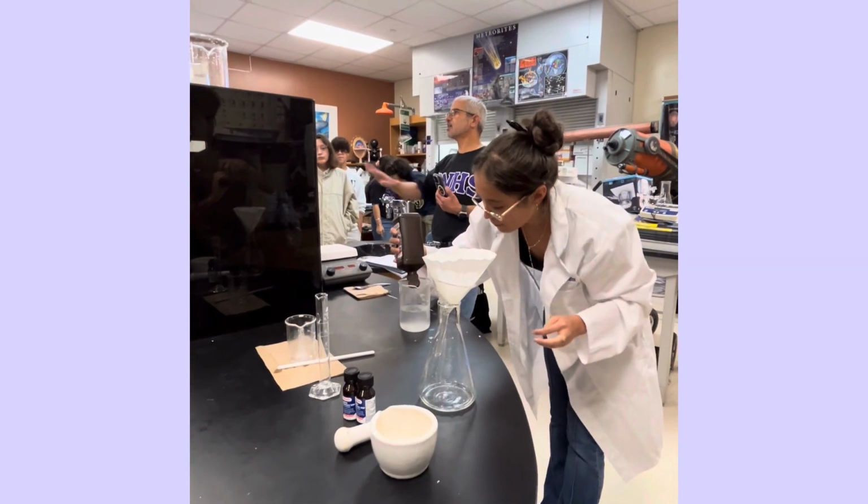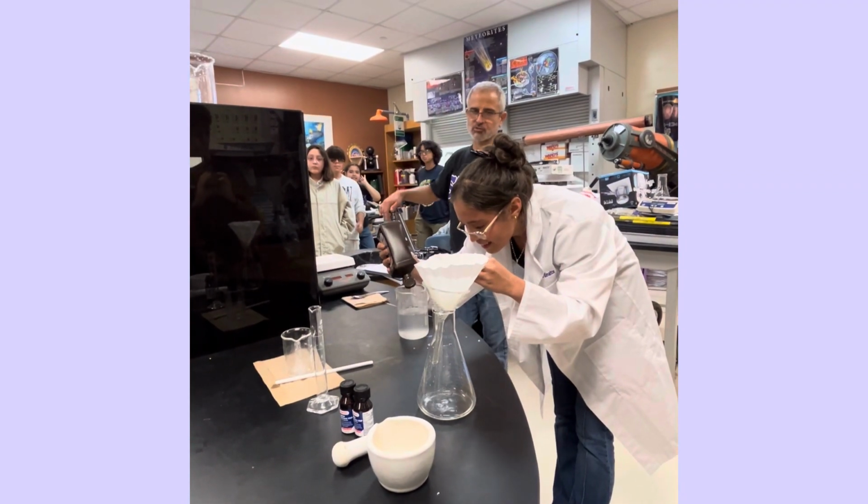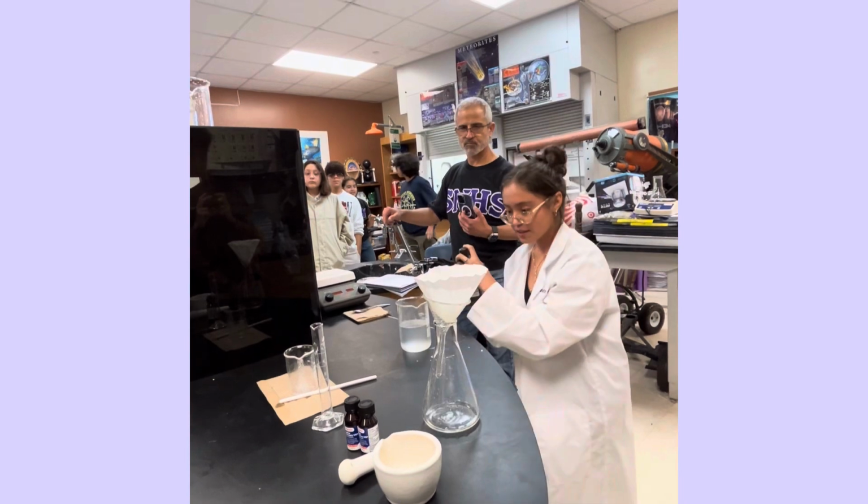You're not missing anything. Sí, no se preocupe. It'll all happen here, okay? So she's just making two solutions. Yeah, right now I'm making solutions.